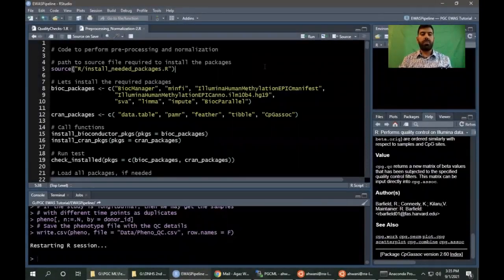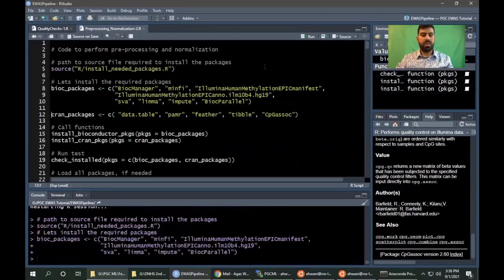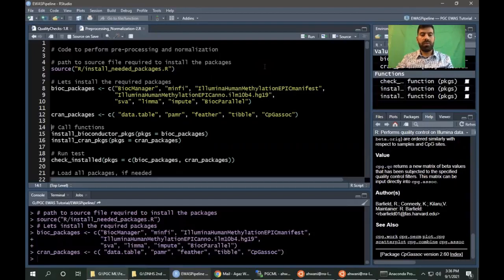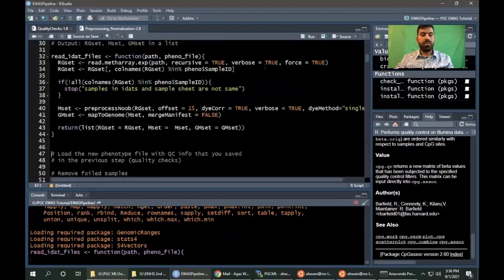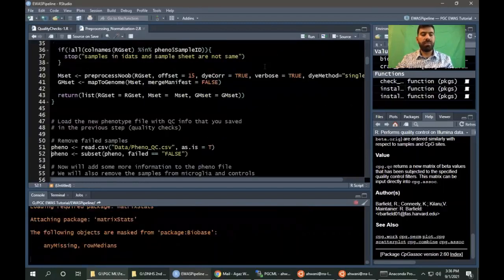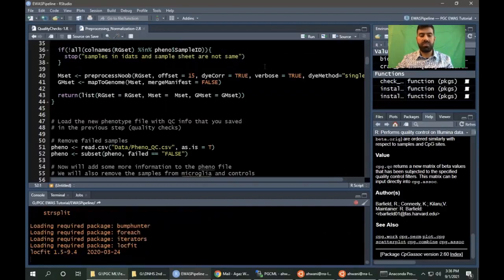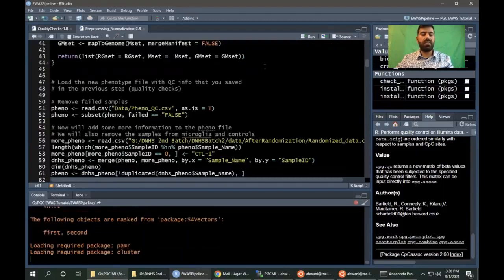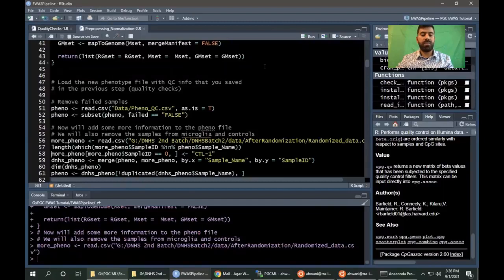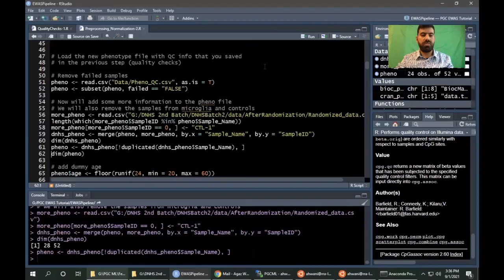In this part, we will be performing normalization, dye bias correction, sex check, and ComBat adjustment. So we will install and load the packages. We will use some main packages like minfi, SVA, and CpGassoc R packages, and some helper R packages to make the process easy. So first we will load the IDAT files and the sample sheet that we saved in the previous file. We will need some more information like age and sex and PTSD that we will use in the ComBat adjustment.